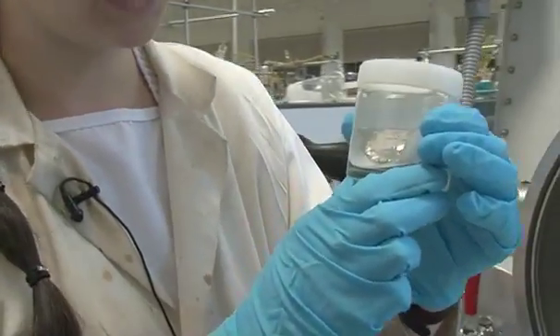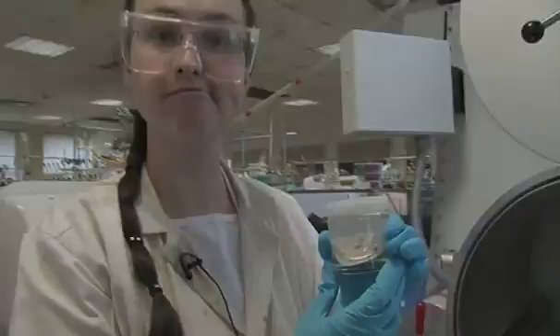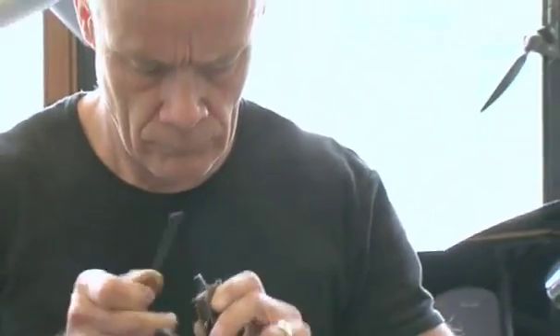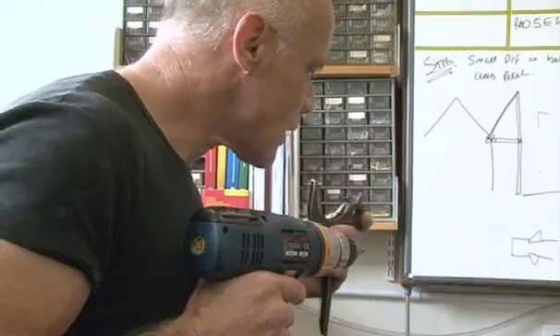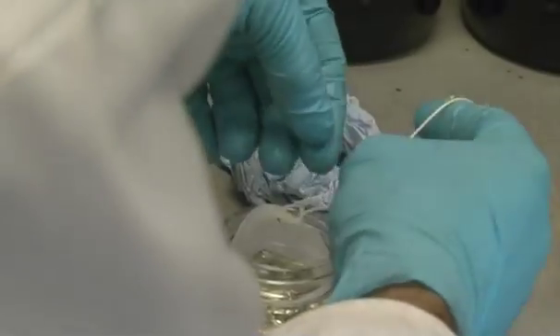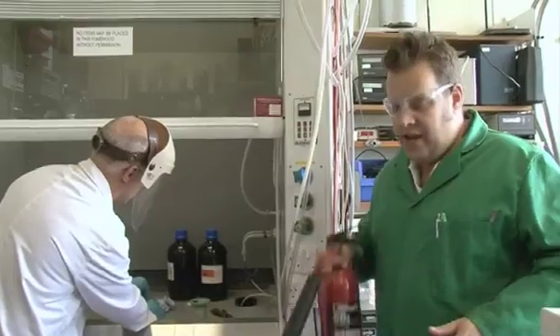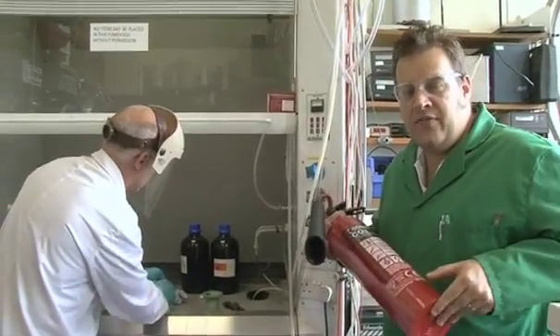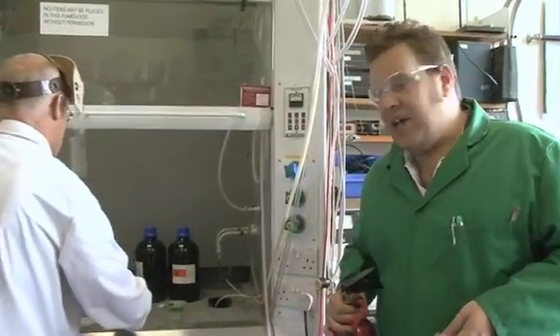So this is ready now for Pete to chuck it in some water. It's always good to be very careful when you do chemistry like this. Just in case something goes wrong, we have the safety procedures ready for us in case we get surprised.